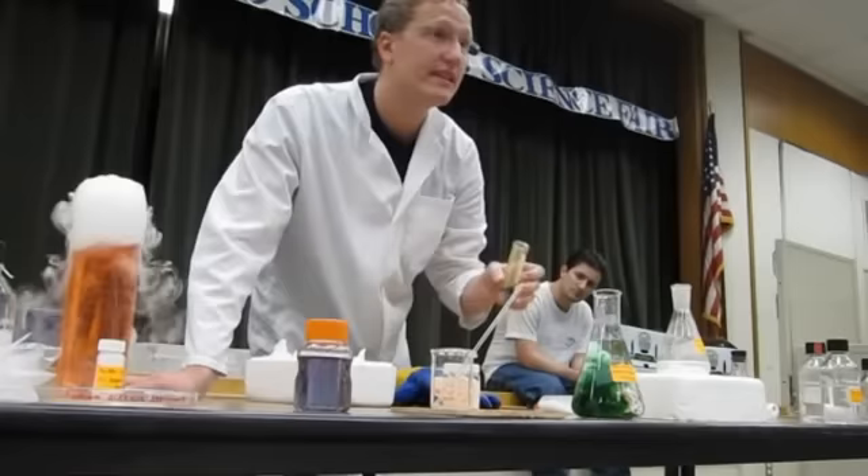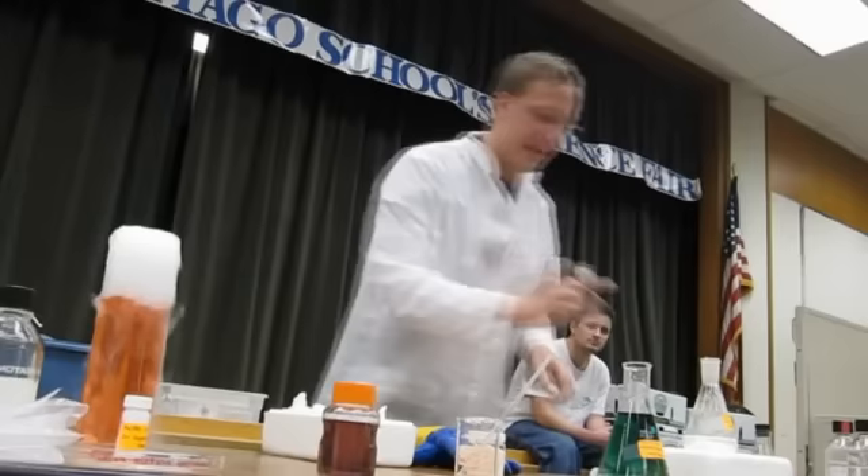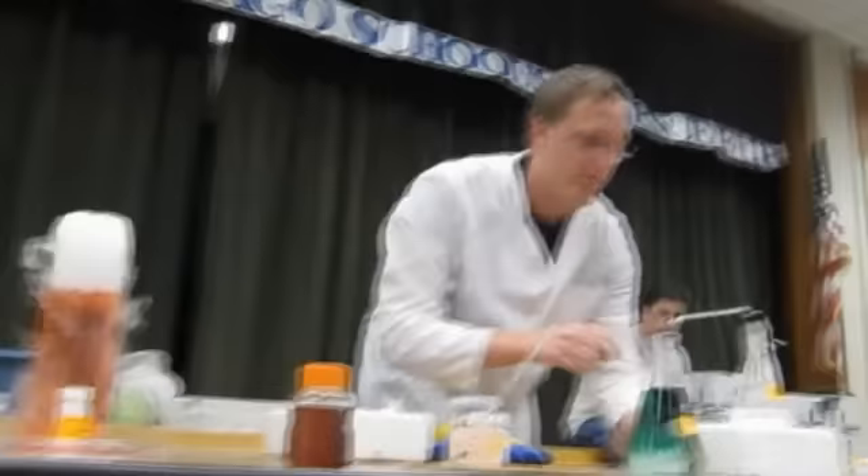Green — perfect. It is green, so I have water, or at least that's one indication. Now here I have something else: KOH. It's a very strong base. I'm going to add that base to this acid and we're going to have a very fast reaction. I've connected a glass tube here, so you will see some gas forming from this reaction.